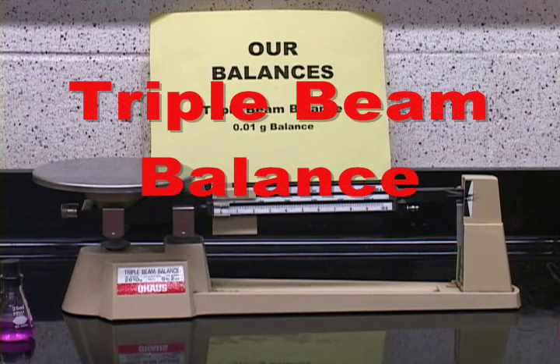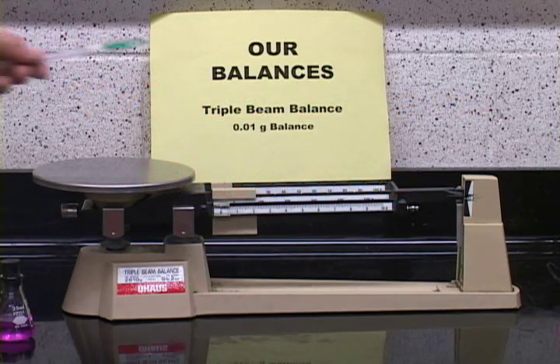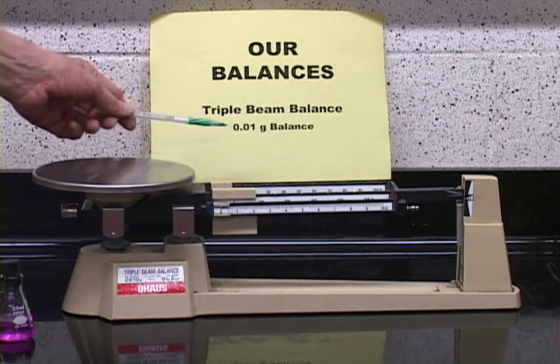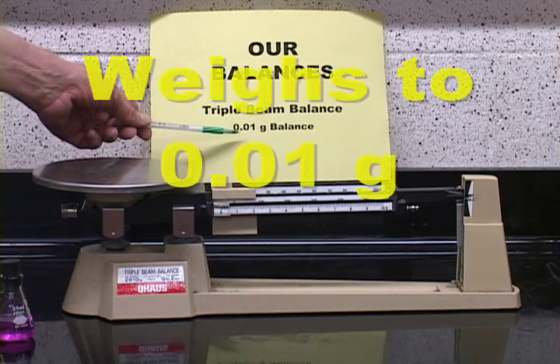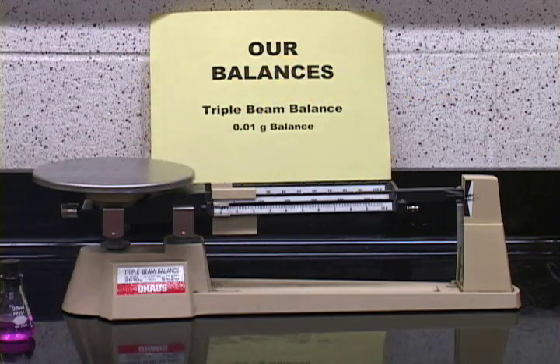Another very useful balance is the triple beam balance. It is not as accurate as the analytical balance. This particular balance only at best will weigh to 1/100 of a gram, 0.01 grams, but it is a very rugged and easy to use balance.